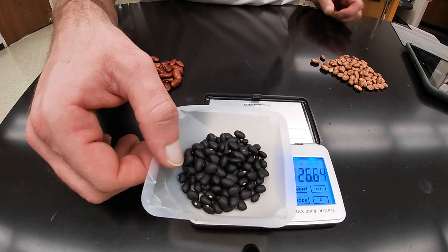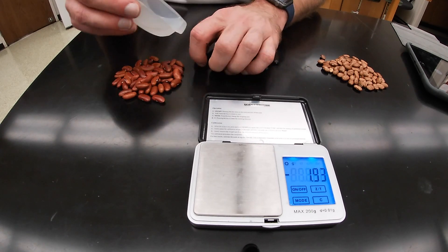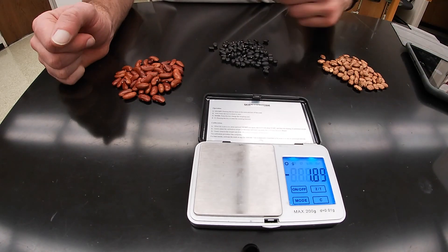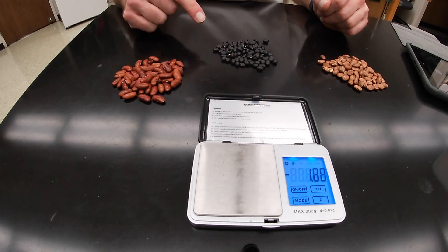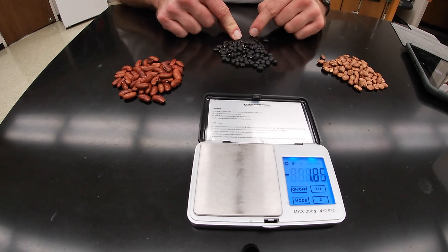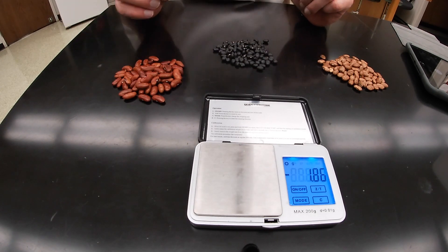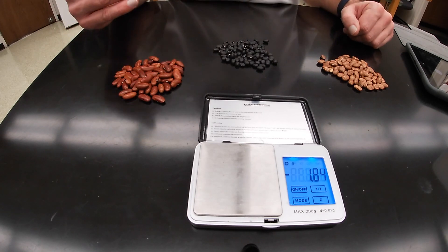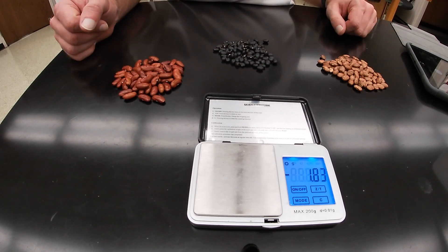Each one of these bean types is supposed to represent an isotope of an element. Since isotopes can have different masses due to their different number of neutrons, these beans are symbolic of those. By determining the average mass of each bean type and the number of each one, I can use the percent abundance from counting all the beans and the average mass from dividing total mass by the number of beans. Using the abundance and average mass, I can calculate the average mass of all beans together — a weighted average, since I don't have equal portions of red, black, and speckled beans.